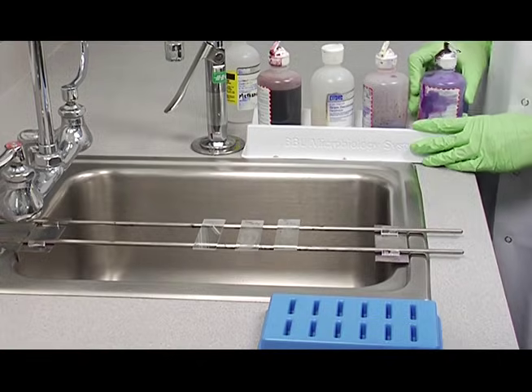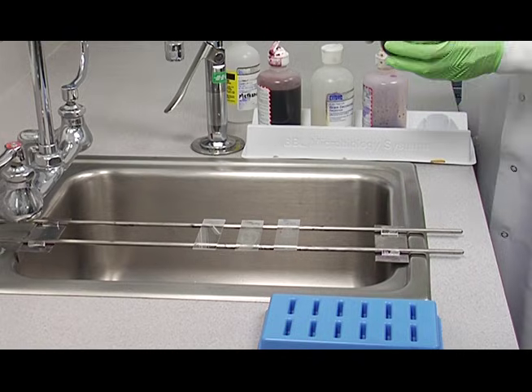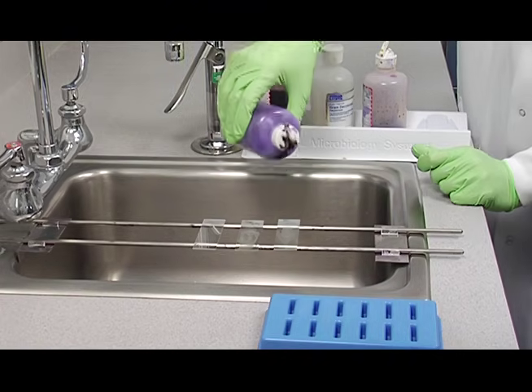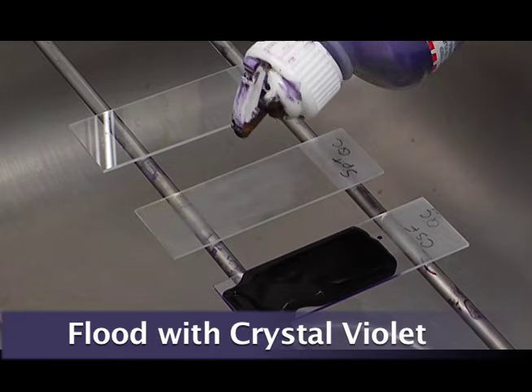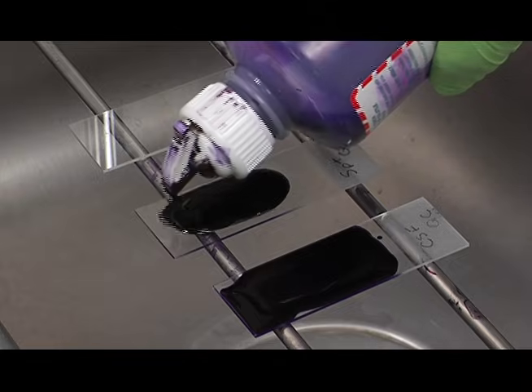And I'm going to flood them with crystal violet for 30 seconds. You just need to cover the area that you're staining. You don't really need to flood the whole slide.